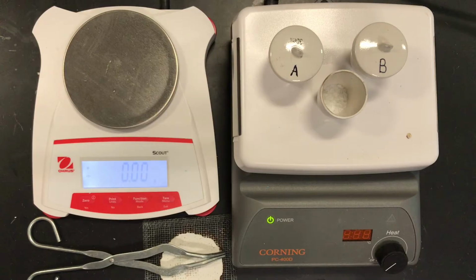The bottom line here is we're trying to write the formula of magnesium sulfate hydrate and determine the actual stoichiometric coefficient in the chemical formula for the water. So it's magnesium sulfate, and we're after how many water molecules are in that definite proportion in the hydrate. So MgSO4 question mark, how many water molecules are in this crystal in a specific ratio.